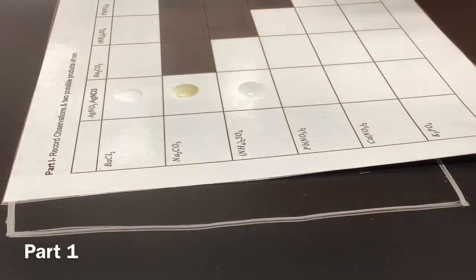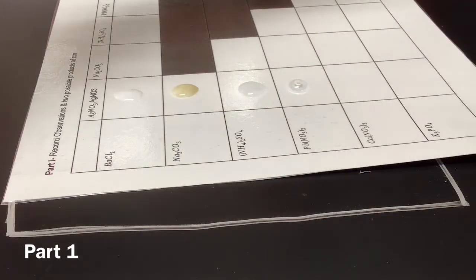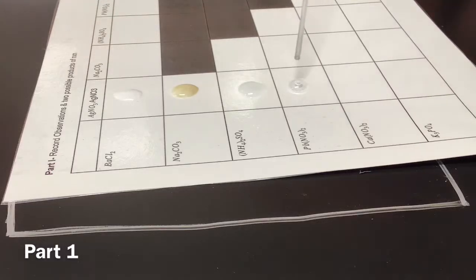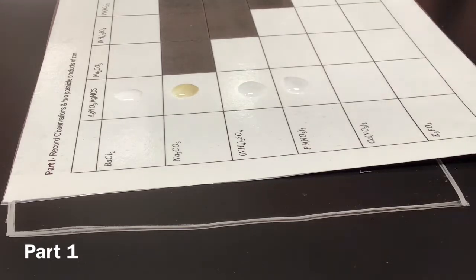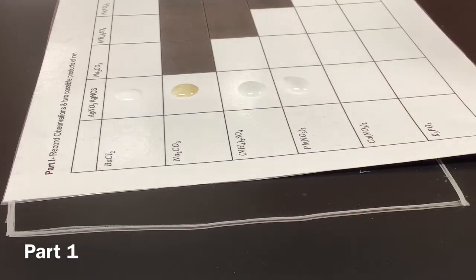So check chlorine's charge. We're gonna go to lead nitrate. Iron's one of the ones that can vary. Since in this formula you have 3 chlorines to every 1 iron, what would its charge be? Plus 3. There you go. Maybe we should give it a sec. It doesn't look like it could all be gonna react. That's not how it works. Wait. This one is less cloudy than that one. Maybe that's just the light. I'd be 90% sure that neither of those did anything.